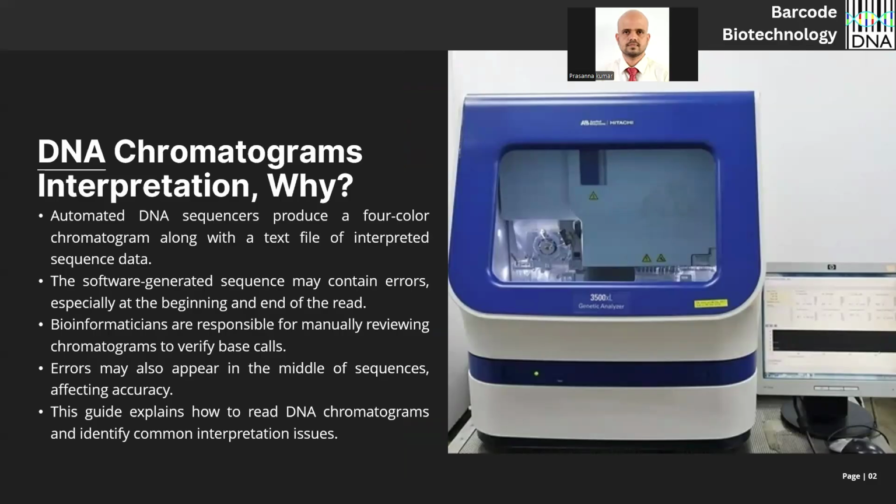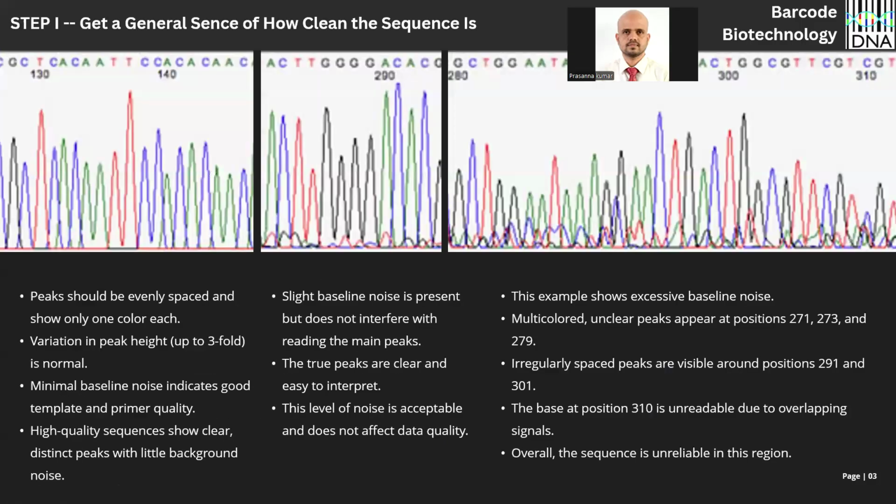So what is this DNA chromatogram interpretation? The chromatograms are nothing but an automated sequencer-produced four-color chromatogram, along with the nucleotide text at the top of the chromatogram. Usually these peaks will contain errors, for many reasons, I will tell you. The errors in the chromatograms are not only machine-based, they actually start from your first process of DNA sequencing, which is DNA isolation. I will tell you how they can cause noise in the chromatogram. As a bioinformatician, we are responsible for manually reviewing the errors before extracting the actual nucleotides out of the chromatograms. The errors may appear at the beginning, the middle, or the end of the chromatogram. We will see that one by one.